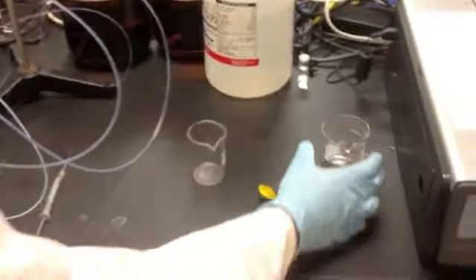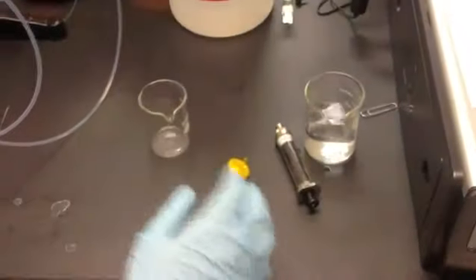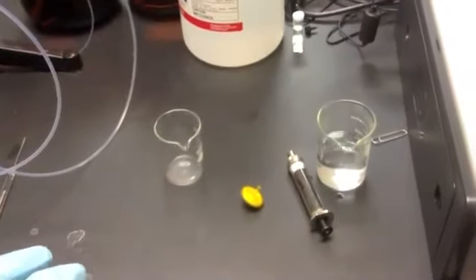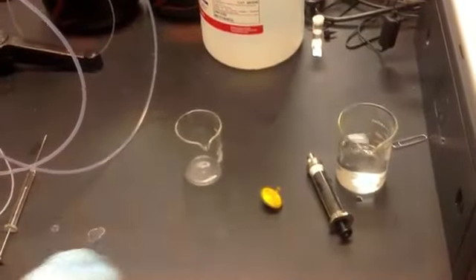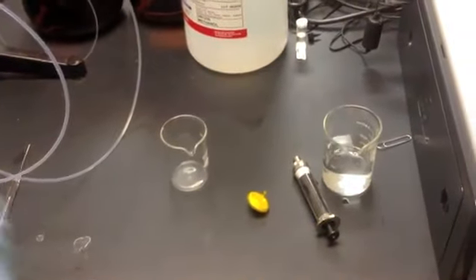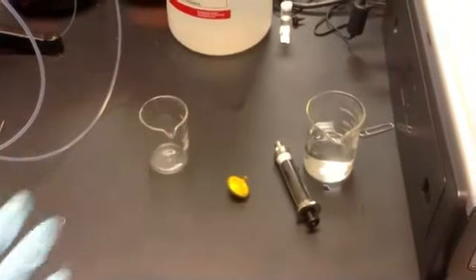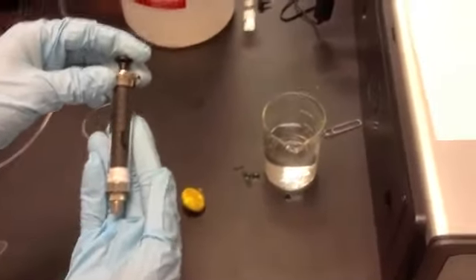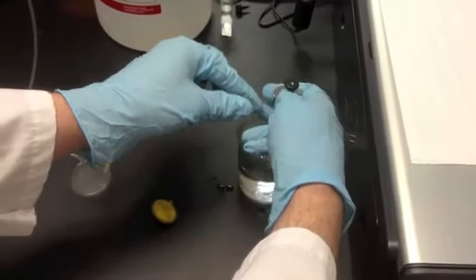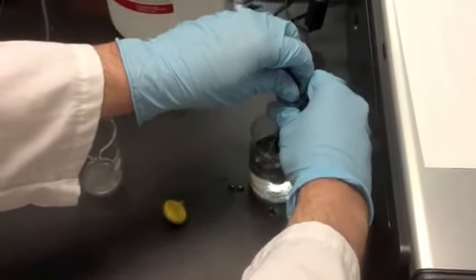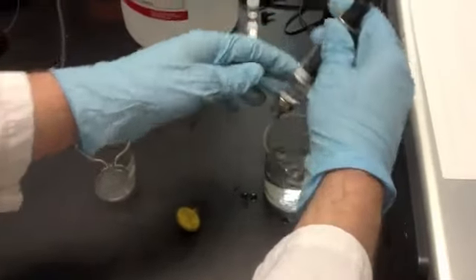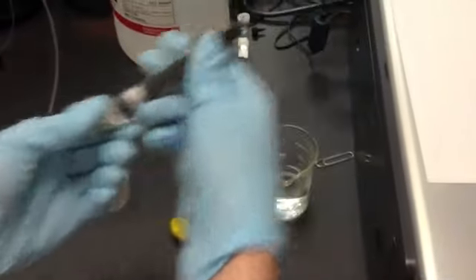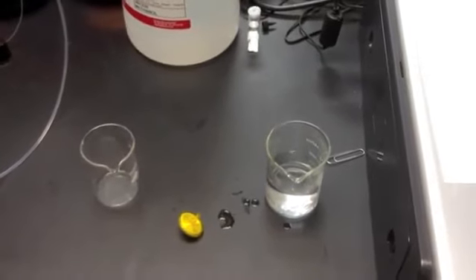Here's our sample, just in the beaker, right here. Like we said, you can use solid as long as it's dissolved. We have to make sure we get the undissolved solid out of our sample. So we take a big syringe, we're going to clean it first, like we do with the IR and the GC. Draw up a good amount just to clean it, and we're going to shoot it over into this waste flask.